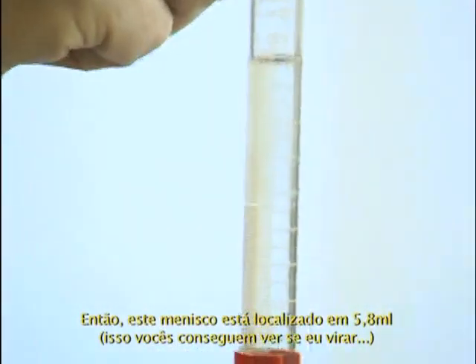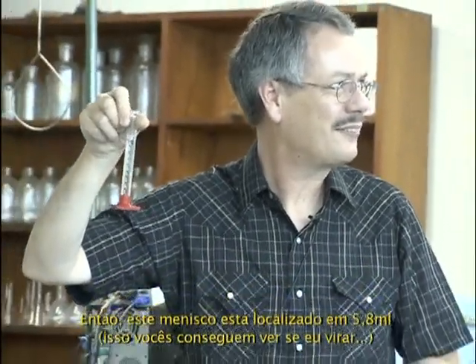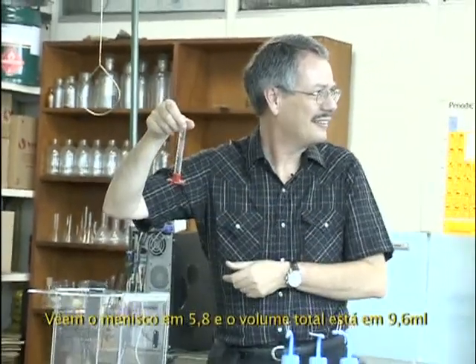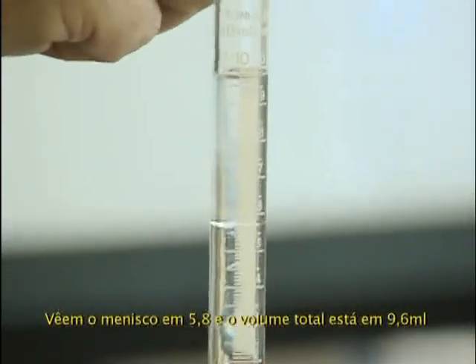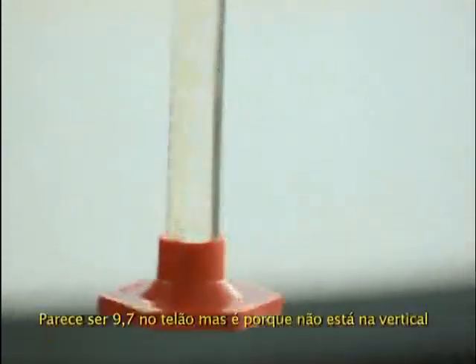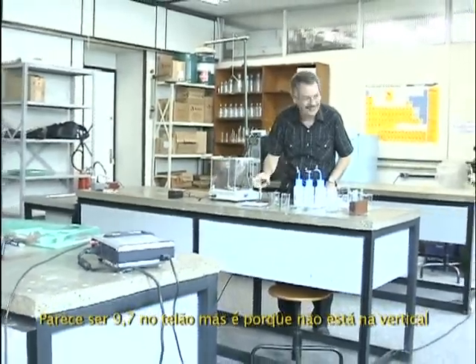So this meniscus is located at 5.8 milliliters. You can see it if I turn it right. There. You see the meniscus at 5.8 and the 9.6 milliliters total volume. It looks to be 9.7 on the screen because it's not vertical.